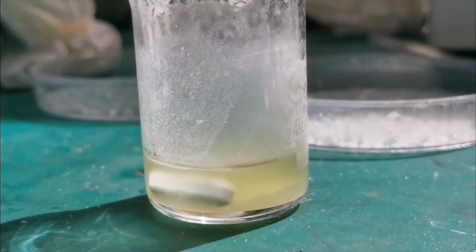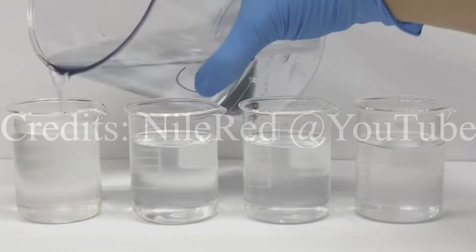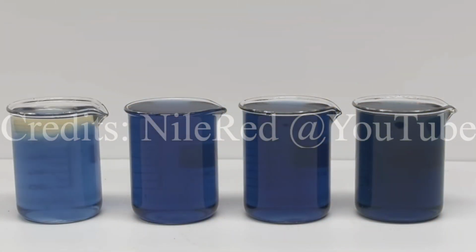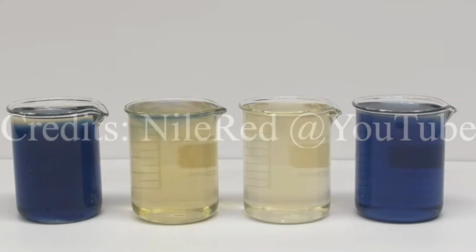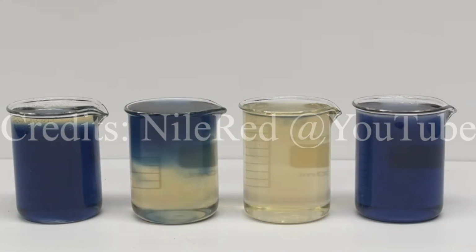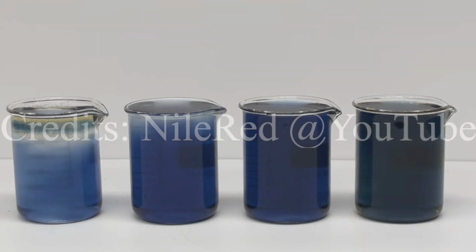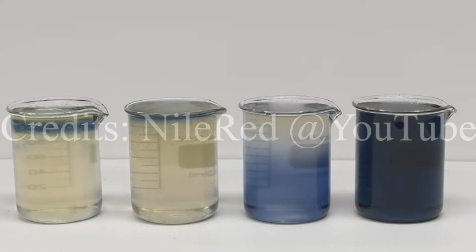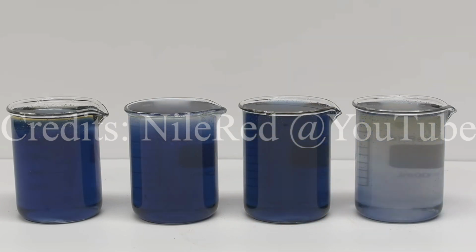However, I wanted my potassium iodate to be as clean as possible, since it will be used for the iodine clock reactions, and small amounts of impurities would significantly impact the reaction. I got all my supplies for the iodine clock, and I have already done a test run in my school, which turned out to be very successful. So I think I will do the reaction along with some other oscillating reactions in the near future.